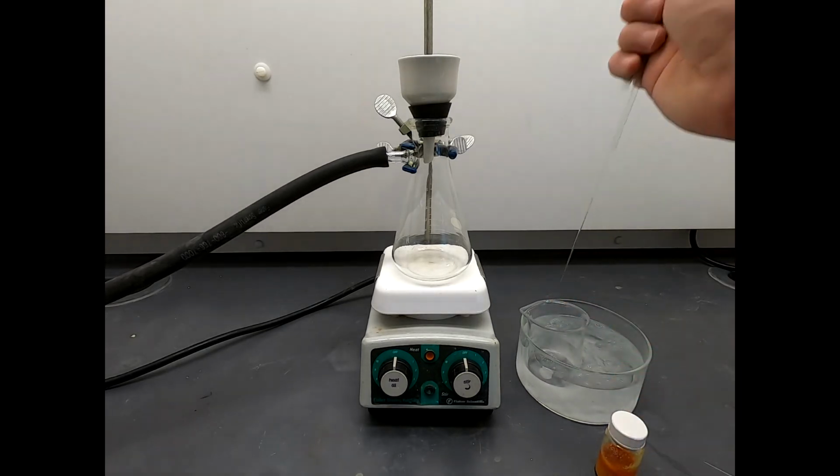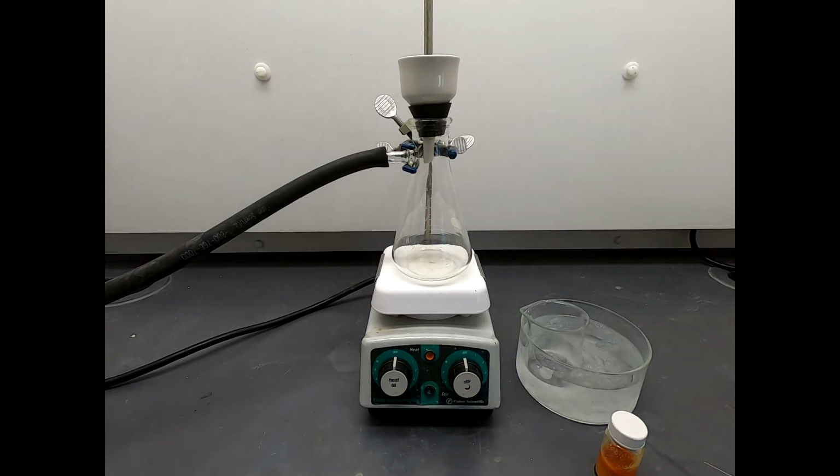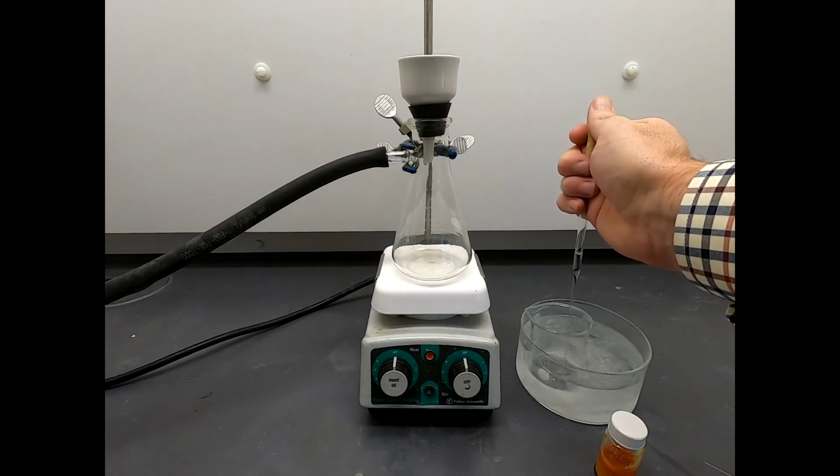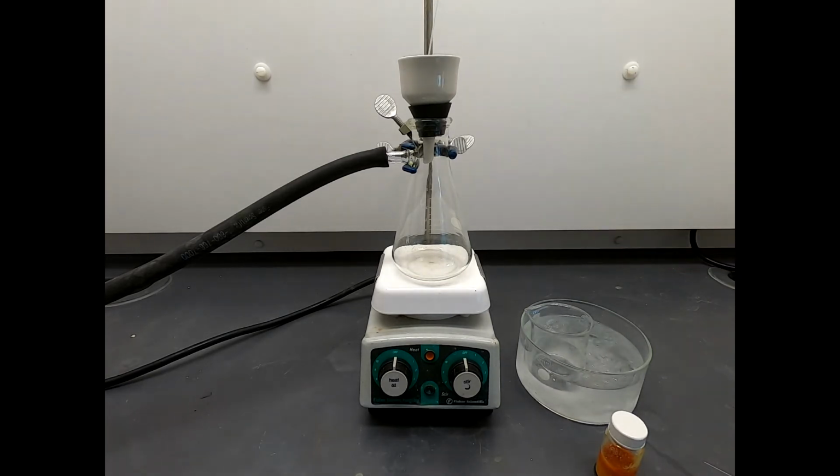So we're going to use methanol to seat the filter paper. So don't think, oh, I just always use water to seat the filter paper. You can't always use water. Only use water if you are filtering primarily a water mixture. And I'm looking in here, and all the holes are covered up. Okay, that looks great.